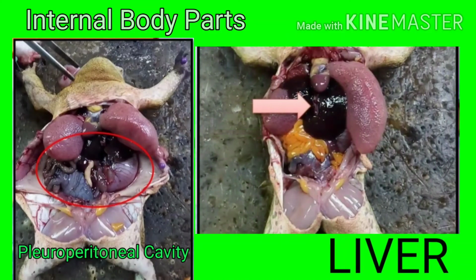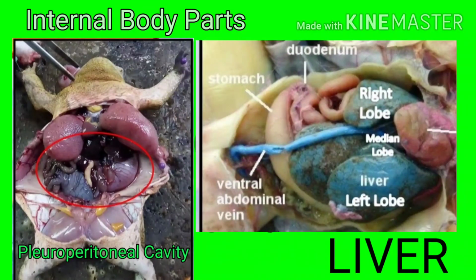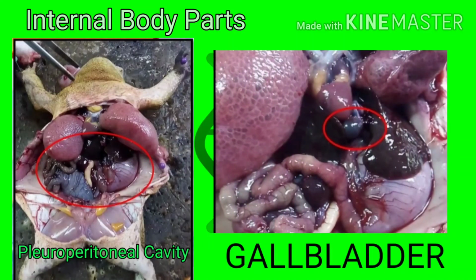Next is the liver. It is the largest gland in the body that has a reddish-brown color due to pigmented granules. It is divided into three lobes: the right lobe, the left lobe, and the median lobe. It produces bile and filters toxins and chemicals. Located at the ventral surface of the liver is the gallbladder, a small rounded sac which stores the bile.